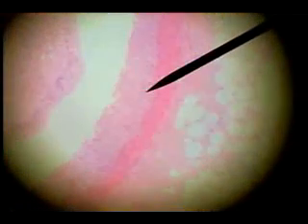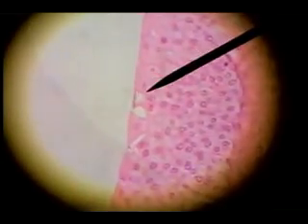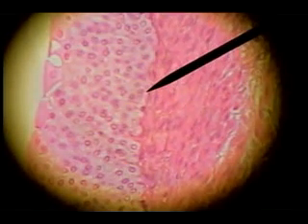We go on down into the calyx and look at the epithelium on the calyx. Here's the basement membrane of the calyx, here's the surface, and this is lined with transitional epithelium, about 6 cell layers thick, and the characteristic balloon cell on the top of the transitional epithelium on the calyx of the kidney.